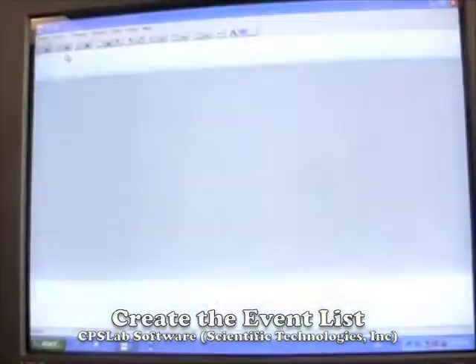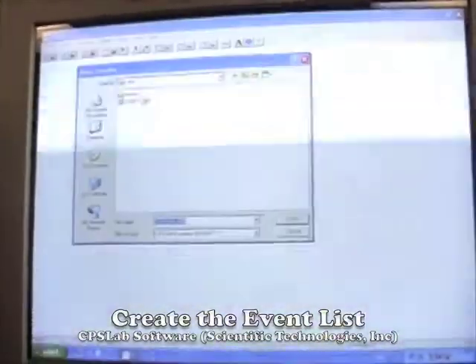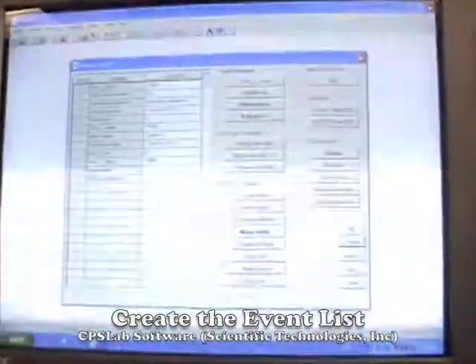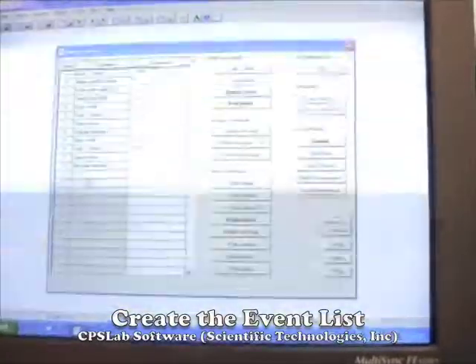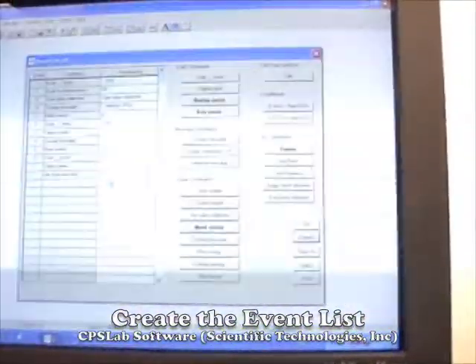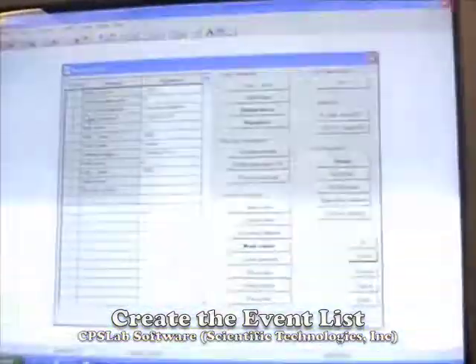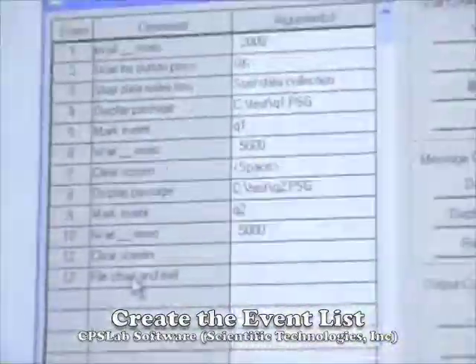So we have to create an event list that specifies what the subject will see, in what order, and the timing of those events. So I've created a little one, but we'll go ahead and open it. So this one just has 12 commands. So the really important ones are the start data collection, and then the file chart and exit. So you want to be sure you have the start data collection when you want to actually start collecting the data, and then file chart and exit should be the last command in the event list.